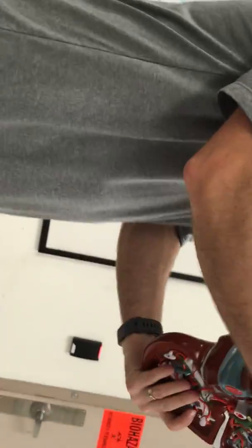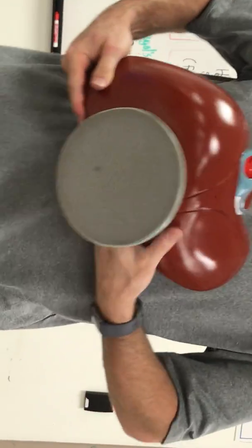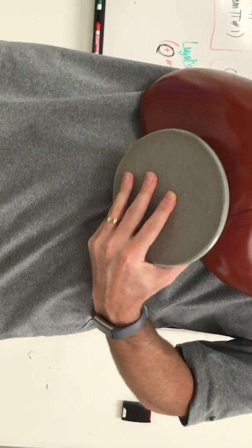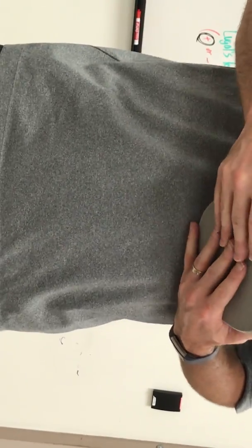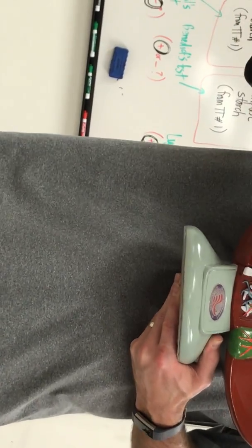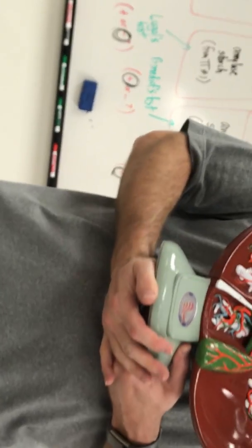The liver sits like this. So what's this lobe here? Right lobe. And then all of this? Left lobe. And separating those lobes, the sheet of tissue? Falciform ligament. So that sheet comes down, and then this cord-like structure follows it. What's this cord-like structure?